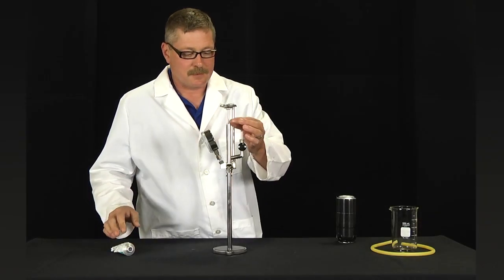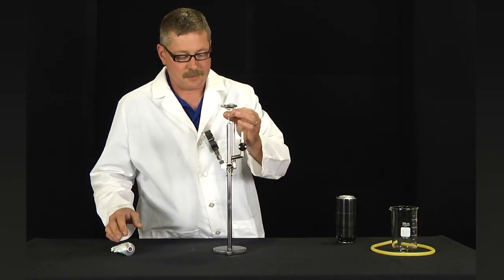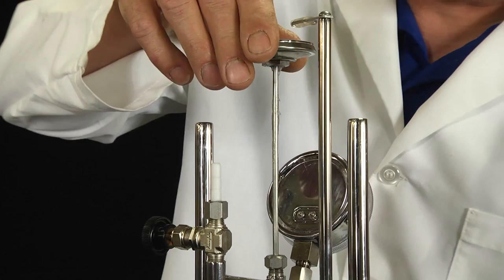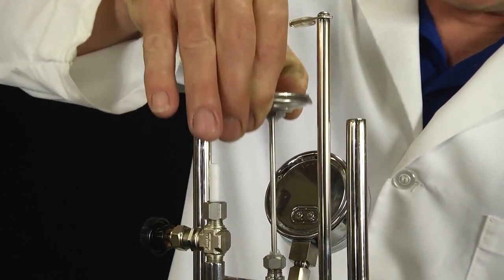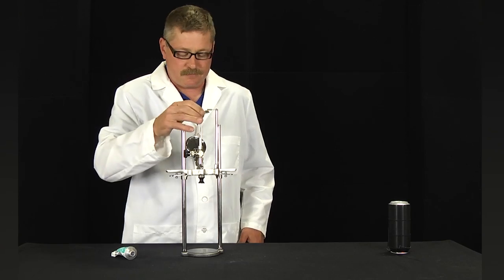To operate, apply a small amount of lubricant to the dial thermometer's stem, work it up and down to lubricate the O-ring, and raise the dial thermometer so that it touches the dial thermometer stop.